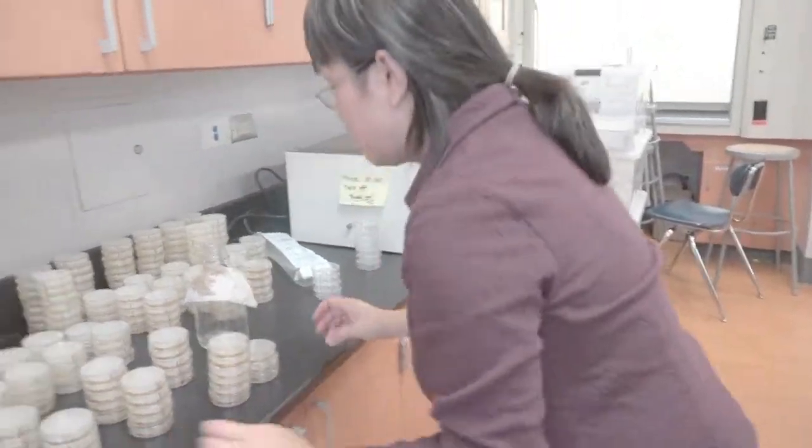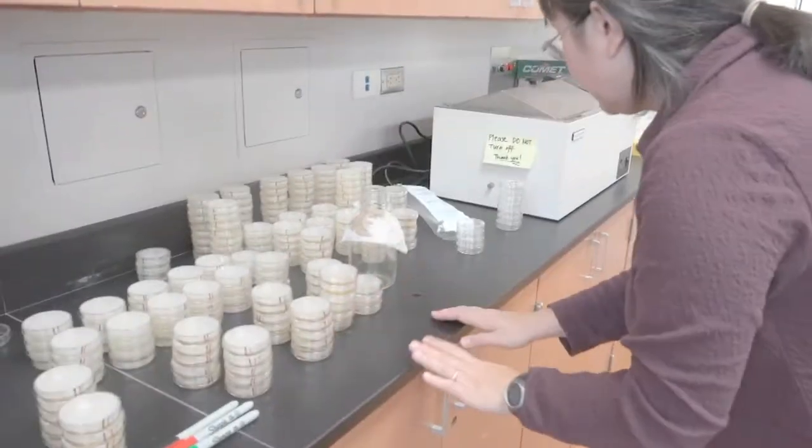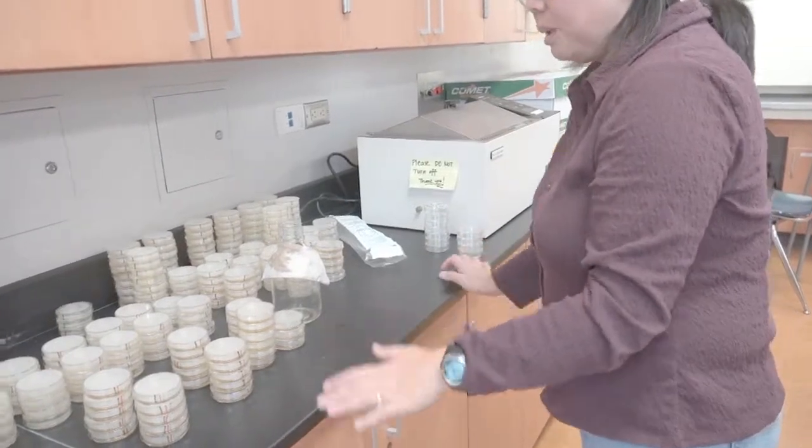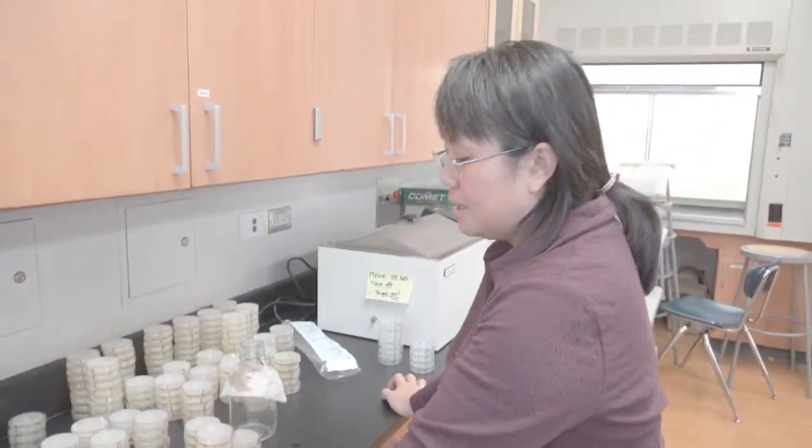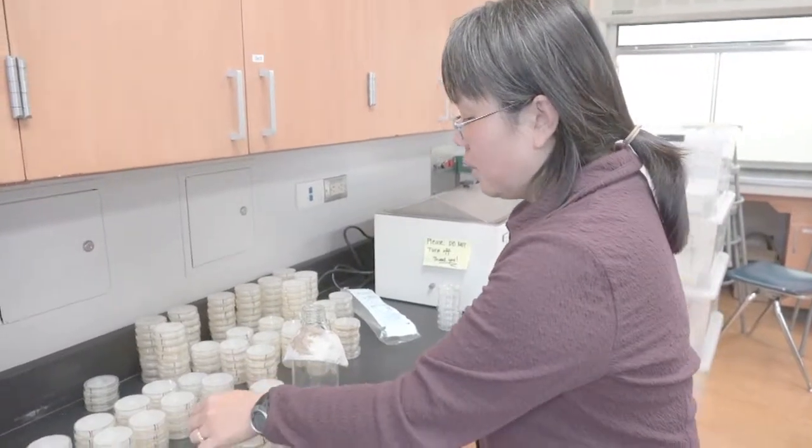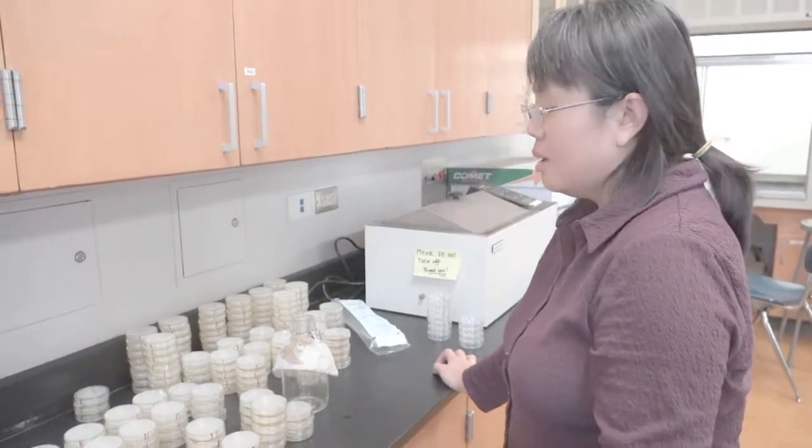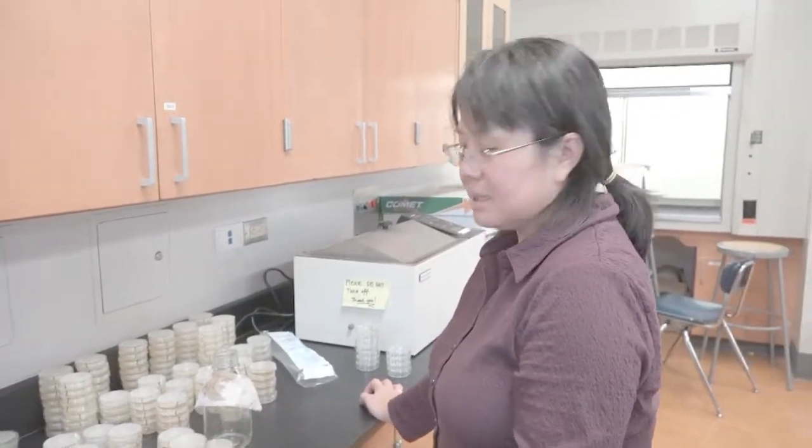Now I have these guys ready. I'm going to push them aside, and notice I'm doing that very gently. I'm going to wait for a couple of days until they cure, which means they're going to dry up a bit. You'll notice a lot of condensation on the lids. We want that to dry up completely before we put them back in the sleeve. Next time, I'll show you how to put these plates back in the sleeve.